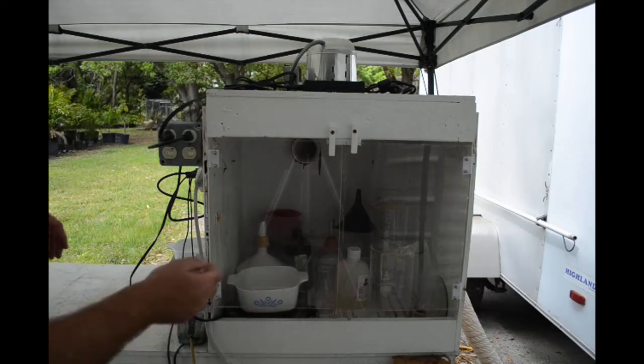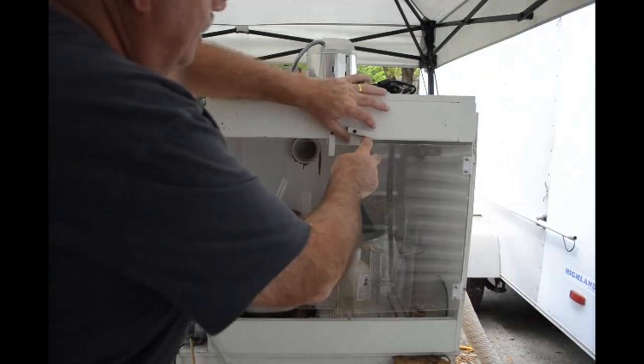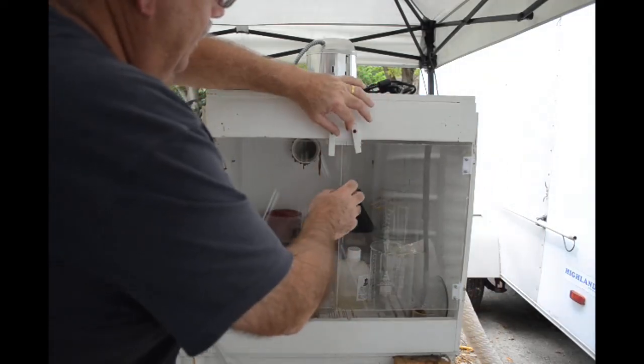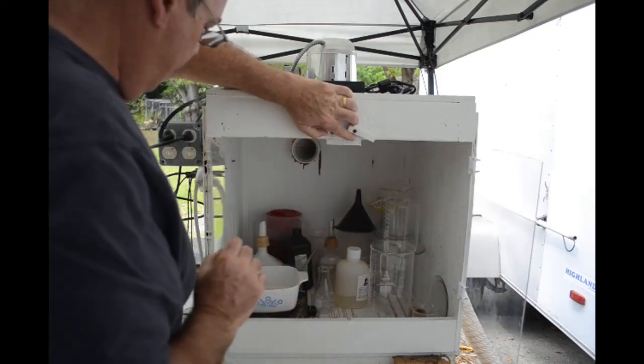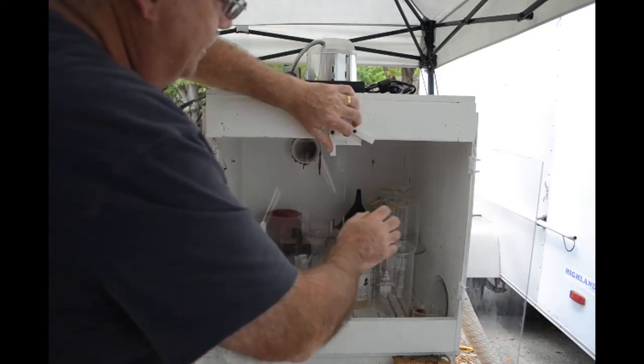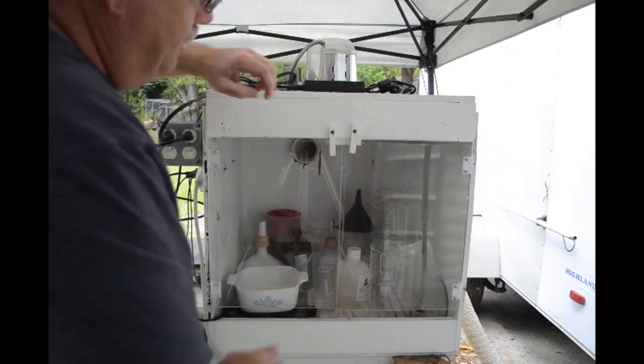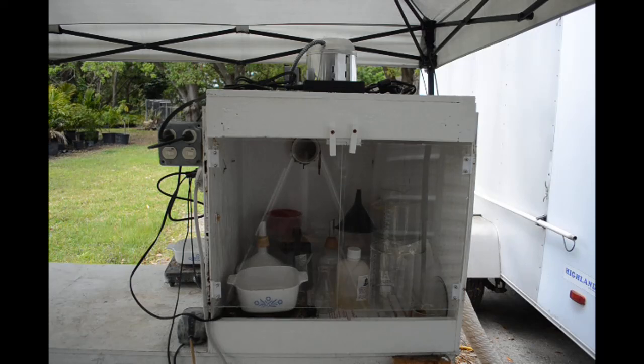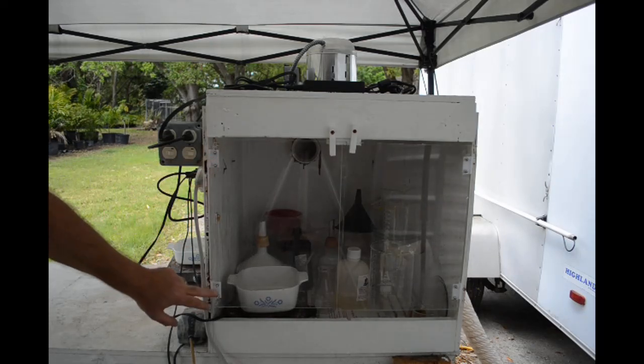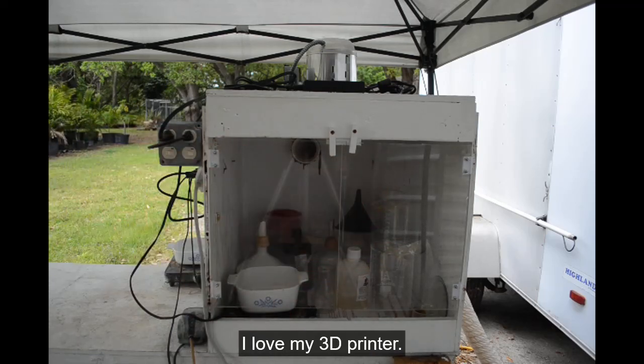I have these little catches here to hold them shut. I've recently replaced the doors just because they were all scratched up and stained with stuff that was not coming off, and I wanted you to be able to see inside what I'm doing.